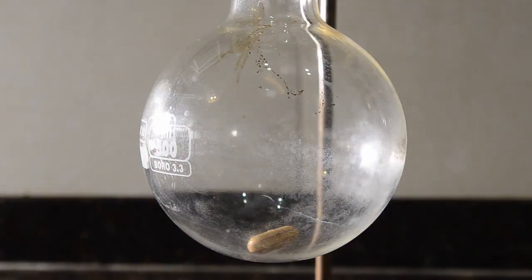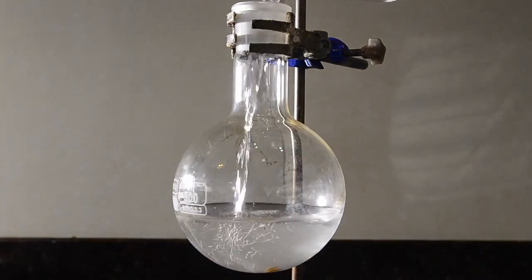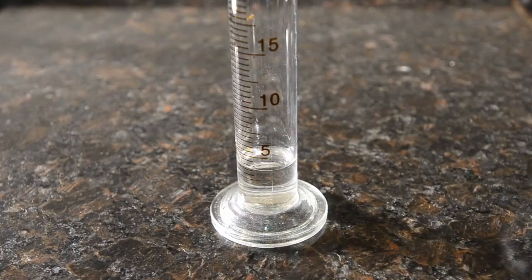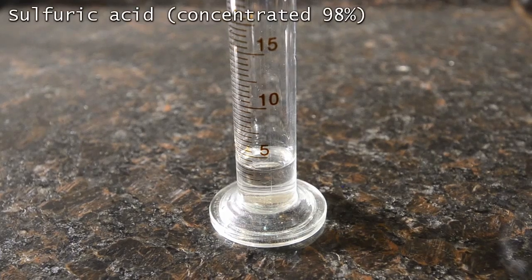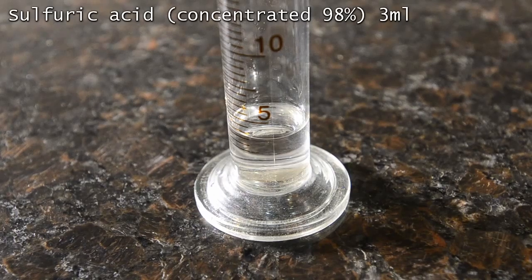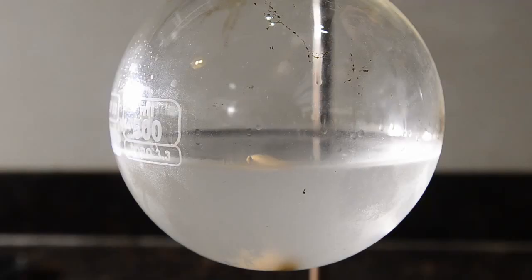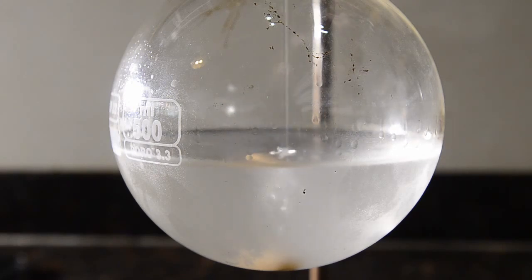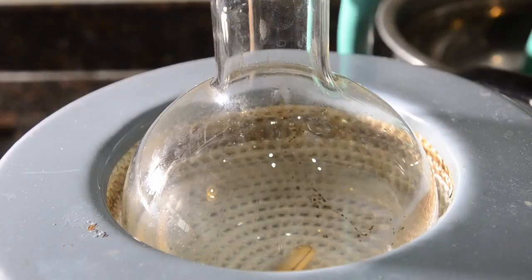We've set up the 500 ml flask. We put a stir bar in there because we originally thought we'd stir the mixture, but we don't actually need it. Some anti-bumping granules would be a good idea though. We've added the chloroacetic acid and ethanol to the flask. And now for our catalyst, we're going to use 3 ml of concentrated sulfuric acid. We added this to the flask, and then set up for reflux using a heating mantle.